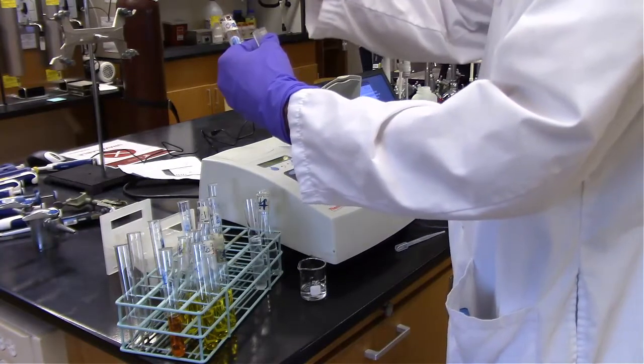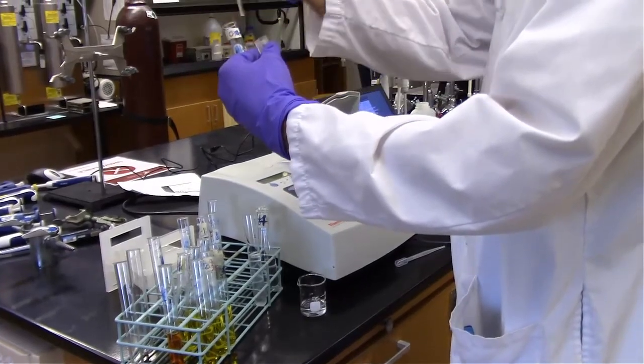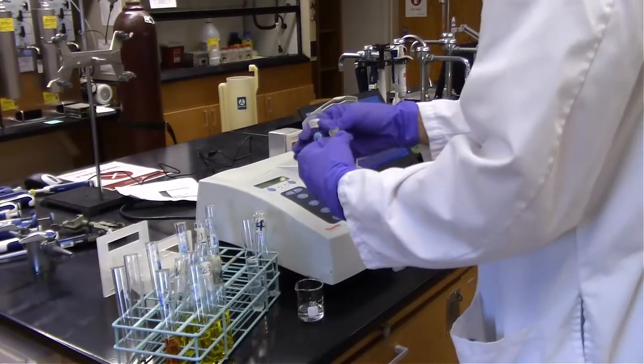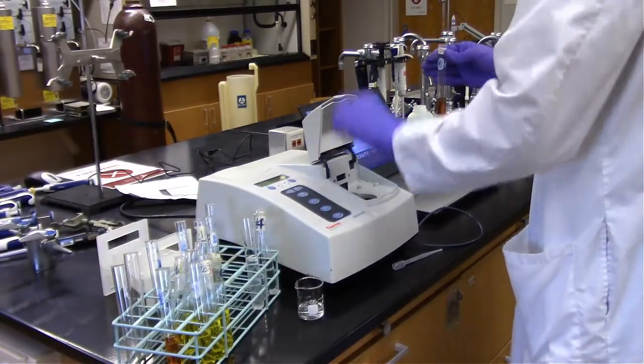So I'm doing the most concentrated ones first. I don't recommend using that one again.